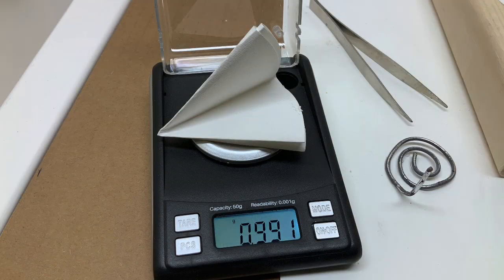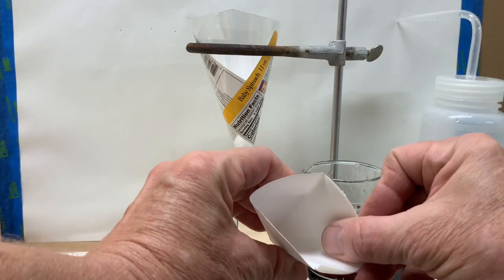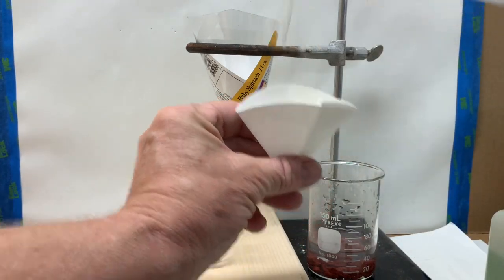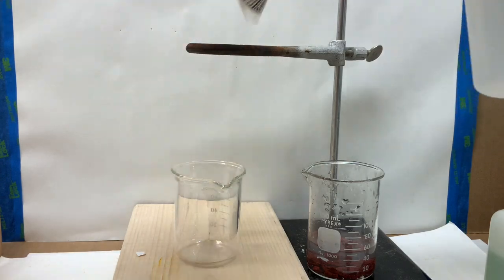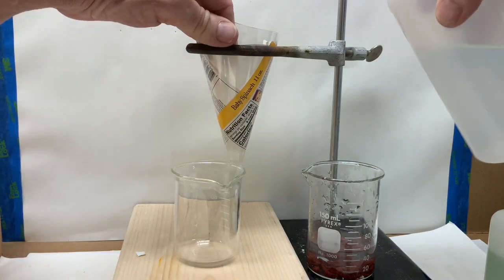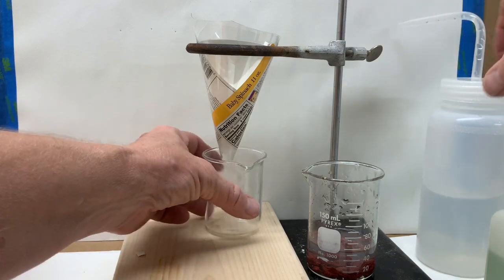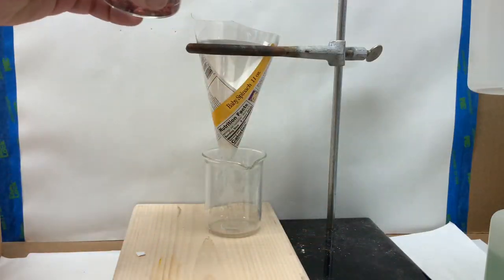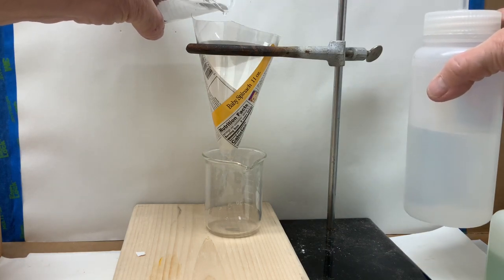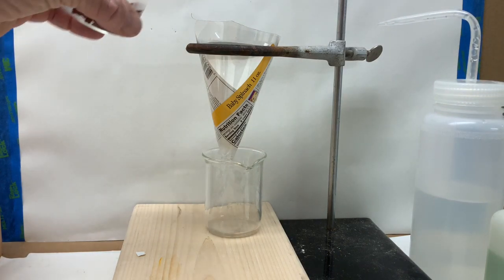Be sure and record the mass of the filter paper. Notice how the filter paper is folded into quarters and then three edges are pushed off to one side while the fourth edge can then be opened up to create a funnel shape. Put into a homemade funnel to support the paper and moistened so that the paper will stay inside the funnel. Now the solution will be added first and eventually all of the solid copper will be washed into the filter paper, separating the copper from the solution.